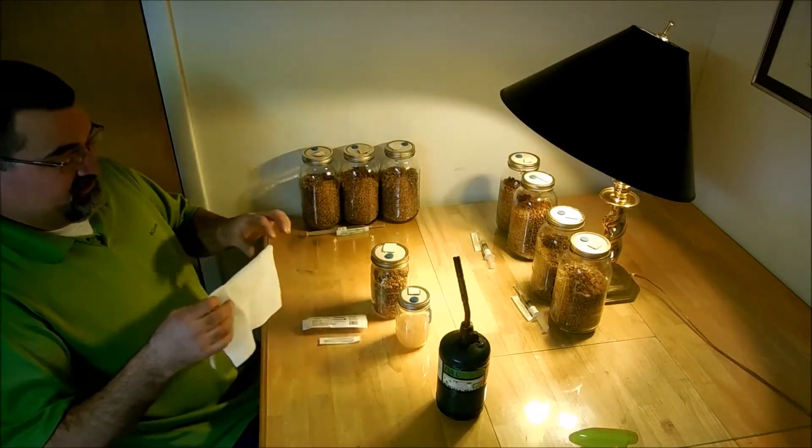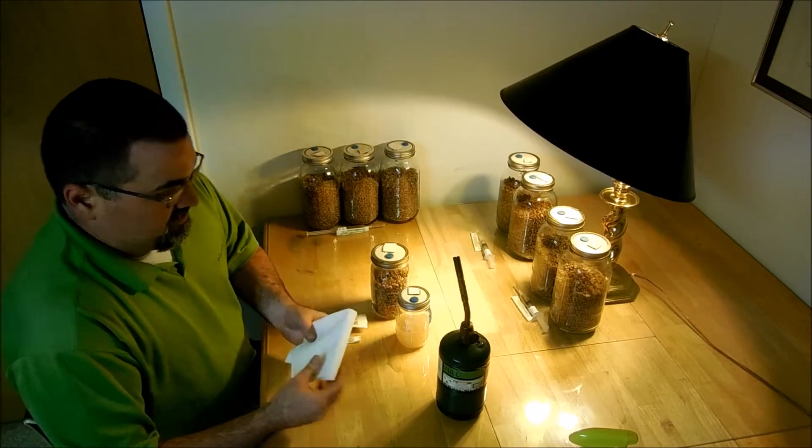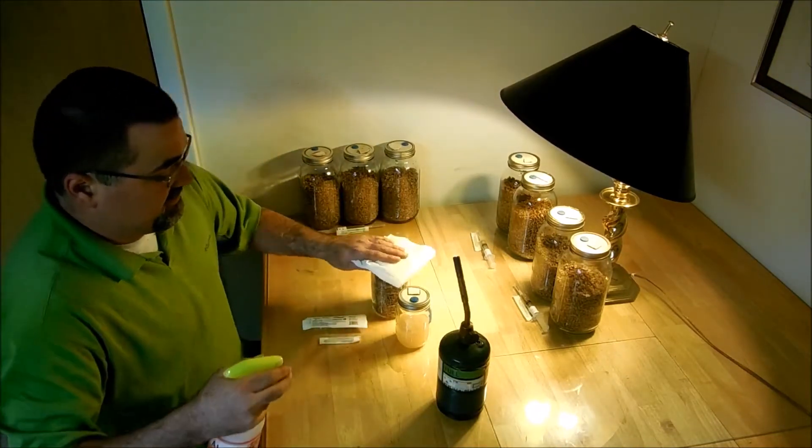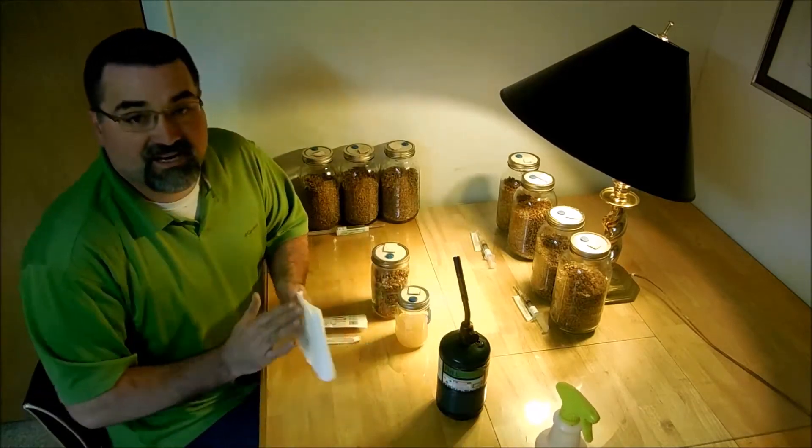For this video, I'm going to discuss my liquid culture that I've expanded here and how to check it, how to test it.